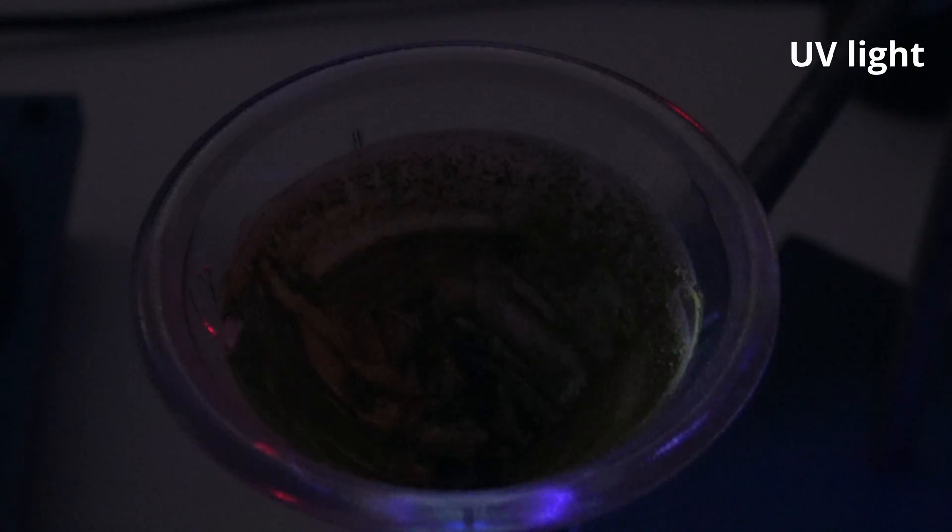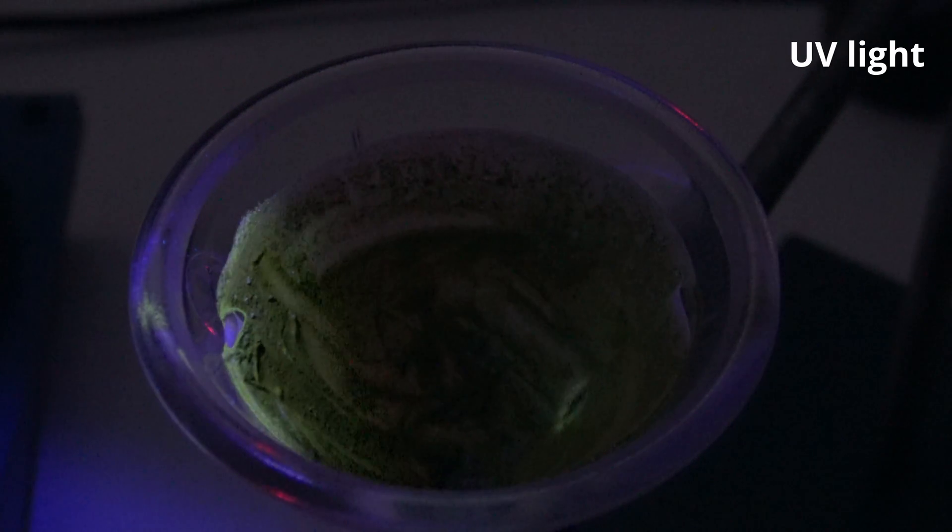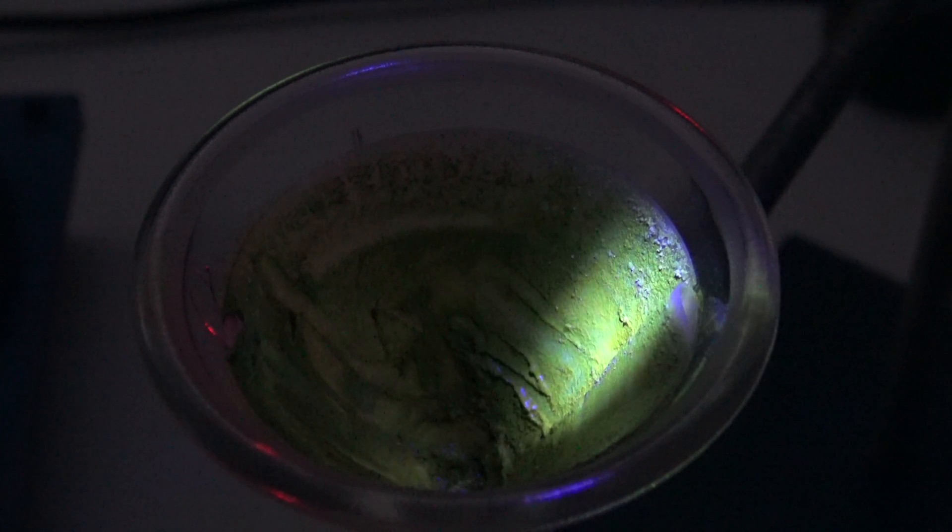In UV light, siloxene is fluorescent and according to some sources it should exhibit triboluminescence and phosphorescence. But I couldn't confirm that in my experiments.